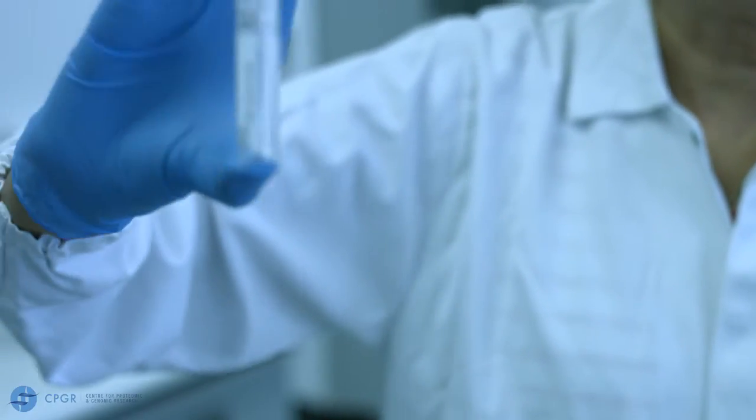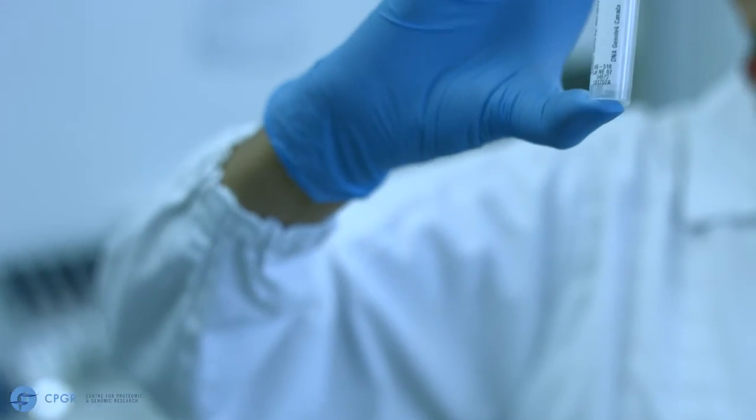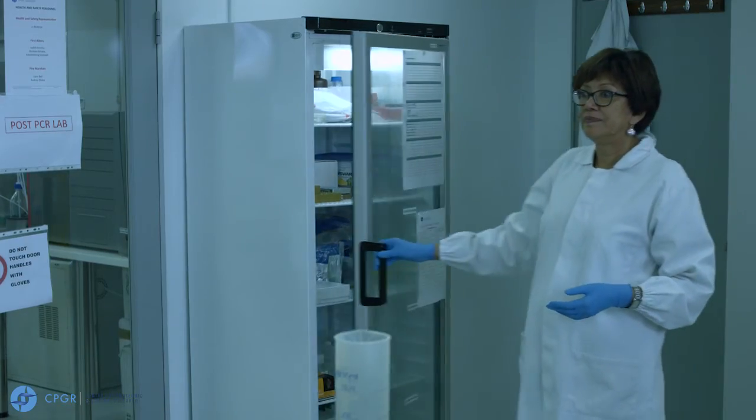All saliva samples must be labelled with patient details prior to storing at 4 to 8 degrees. To extract DNA from your saliva samples, refer to the protocol which comes with the saliva collection kit.